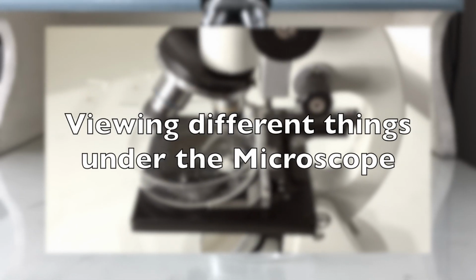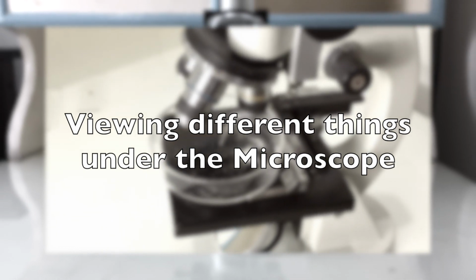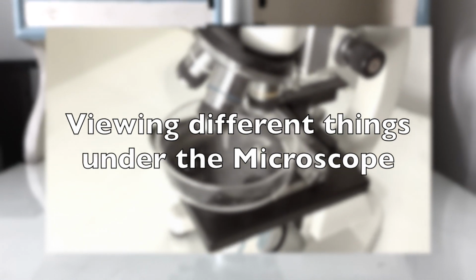Today, we are going to look at 3 different things under the microscope. Enjoy!